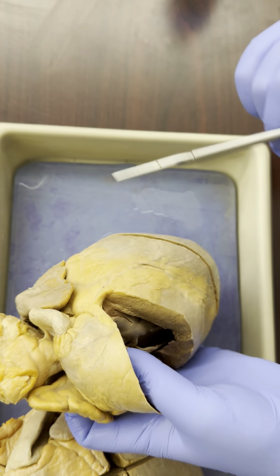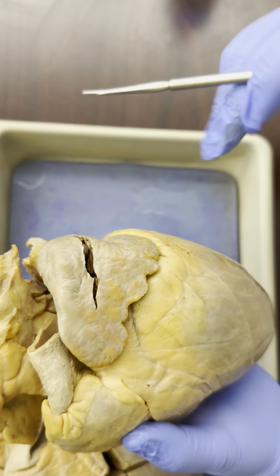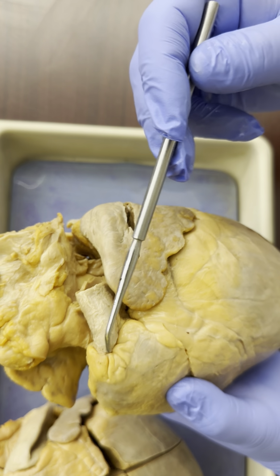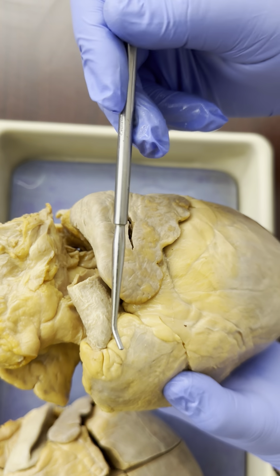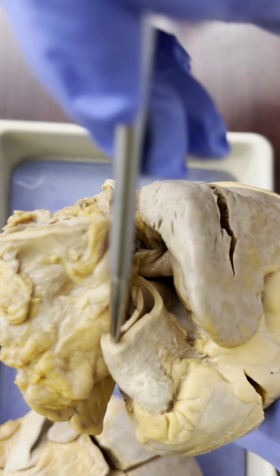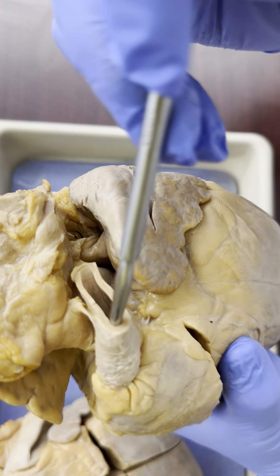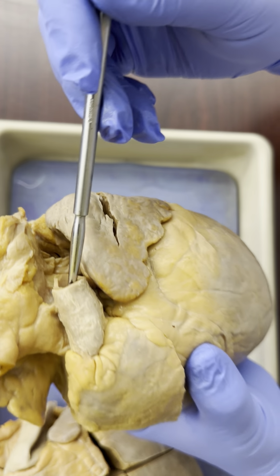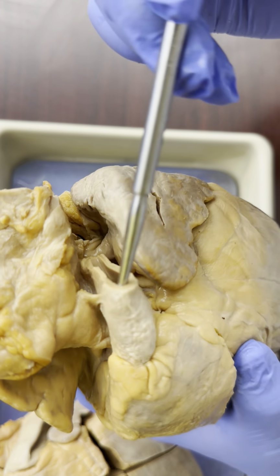Now, leaving the right ventricle, let's take a look at the outside of the heart. The outside of the heart, there's some vessels up here at the top, and the very front vessel that we see on the top of the heart in front. So superior anterior vessel, this large vessel right here, this is the pulmonary trunk. And if it were a little bit longer, it would immediately split into left and right pulmonary arteries. But this is the pulmonary trunk, and it is leaving the right ventricle.